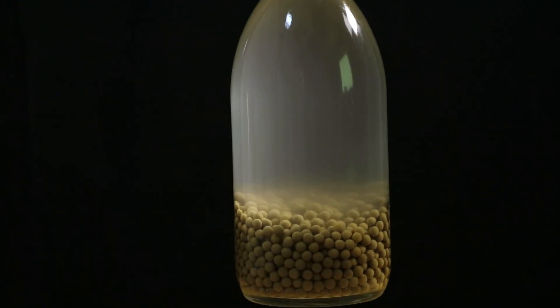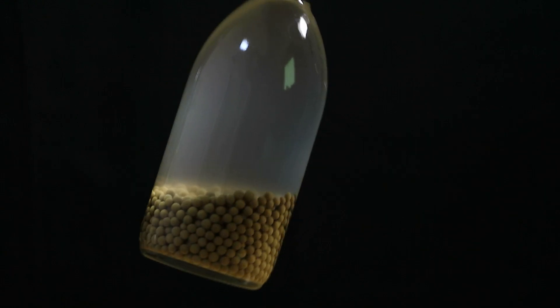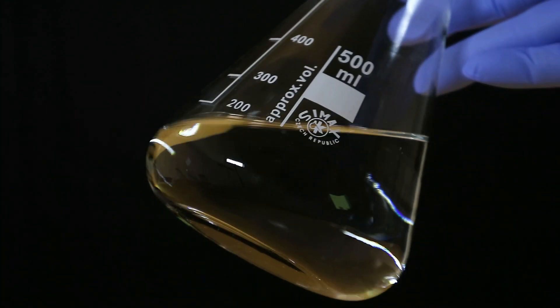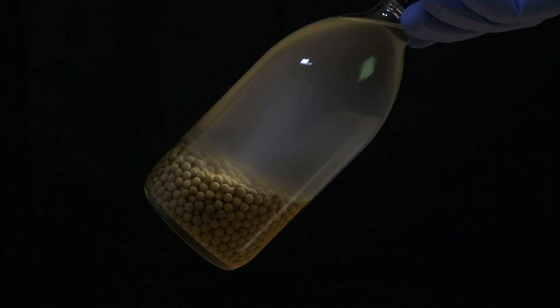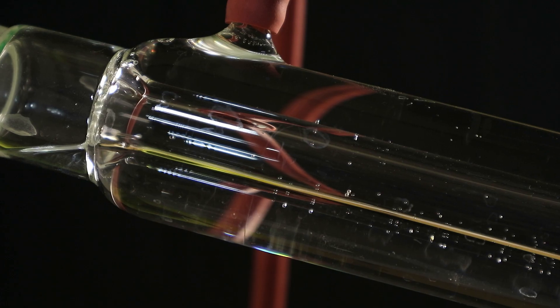Look I mean in the end it's murky is what I'm trying to say. Look at this. This is so unsatisfying. This is literally the last thing you want to see when you do chemistry like murky solutions. Things that just are suspended in your solution. You start with something less pure but much more clear and you finish with something which is technically pure but like it's definitely not clear. It's definitely not nice to look at.